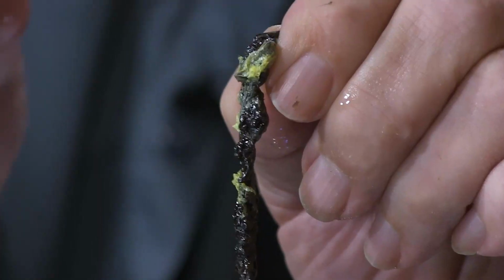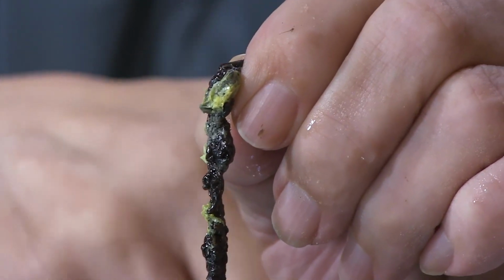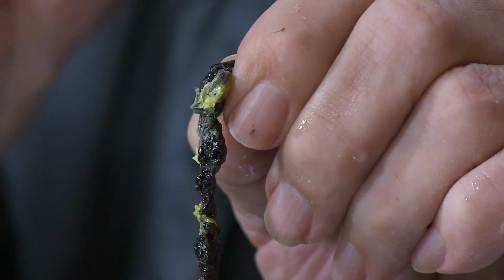It's great. It's starting to polymerize. You see that right there on the end of my finger? It's starting to turn yellow again. That looks pretty gross, doesn't it? You just learned at Midnight Science Club from Wizard 4, a 225-year-old chemistry demonstration.